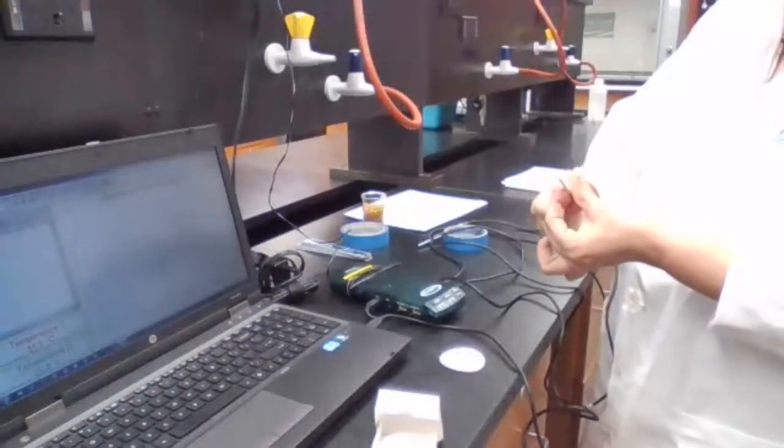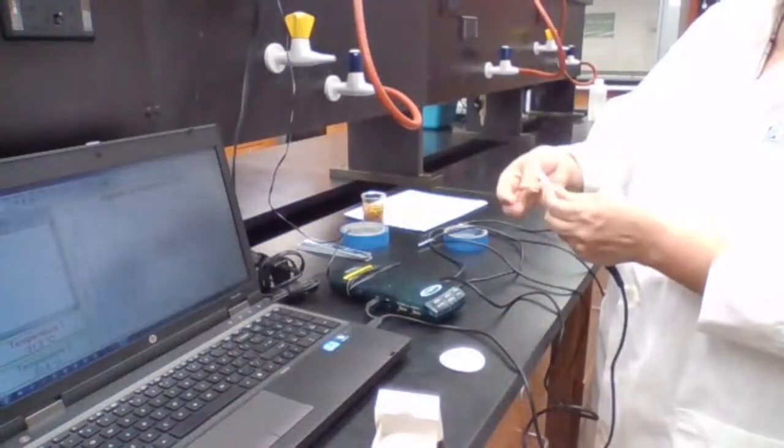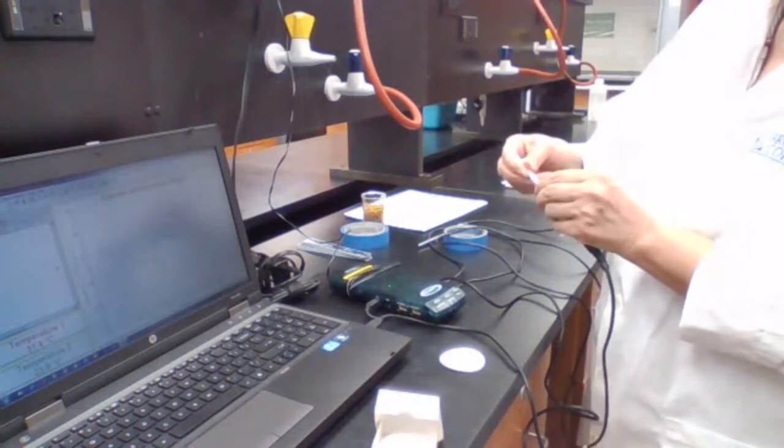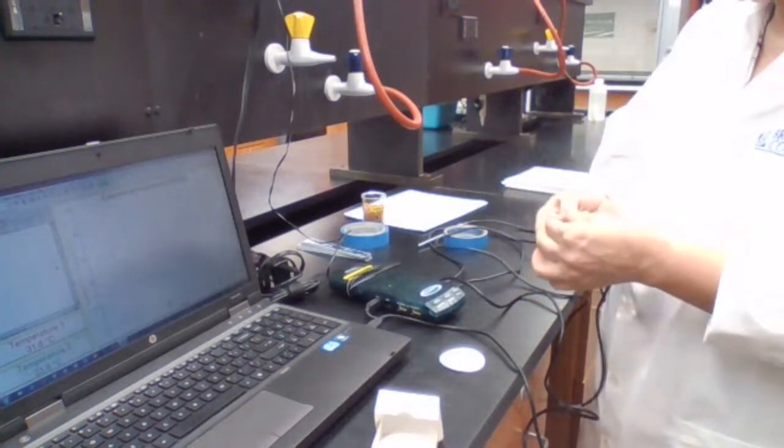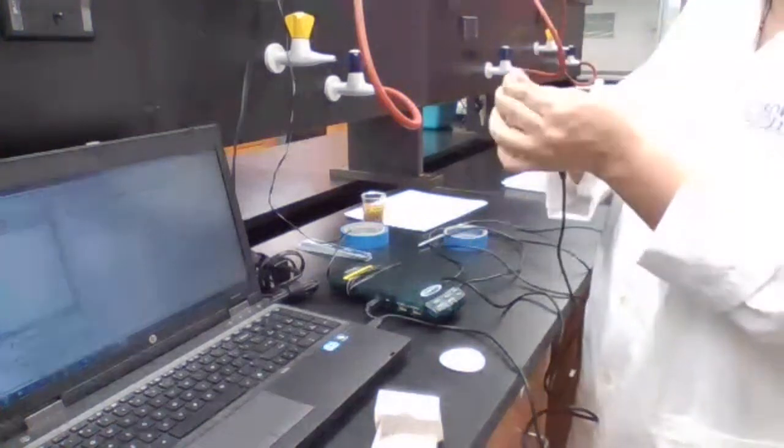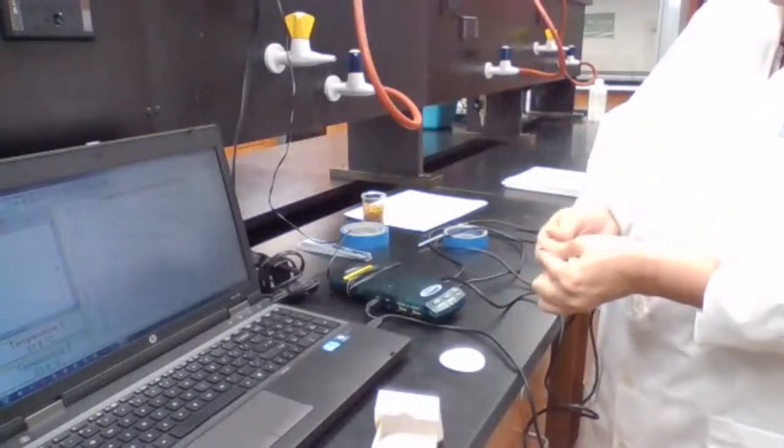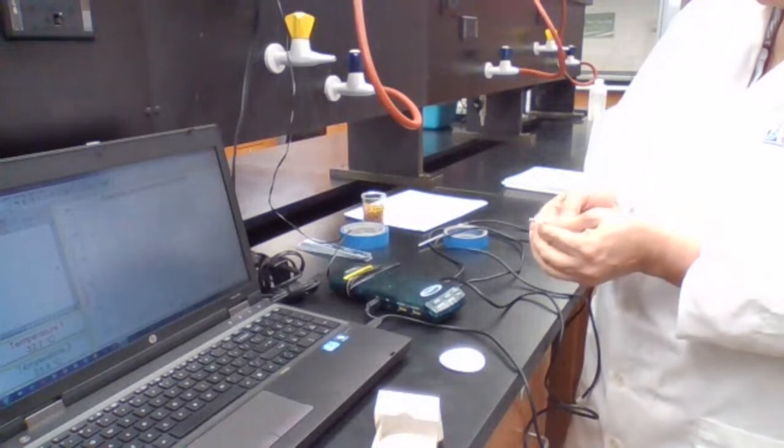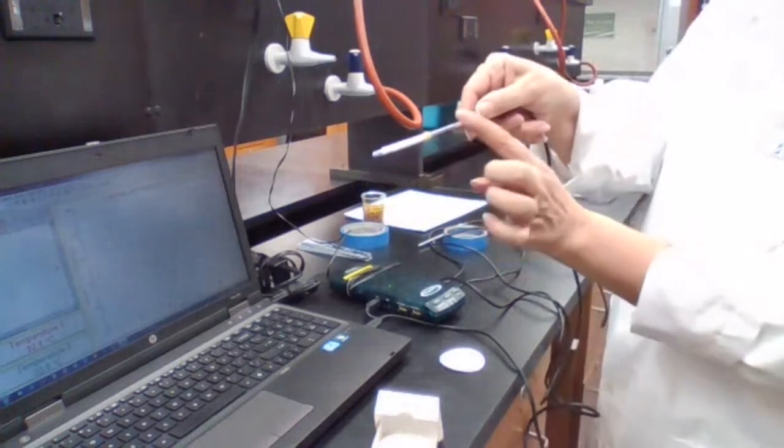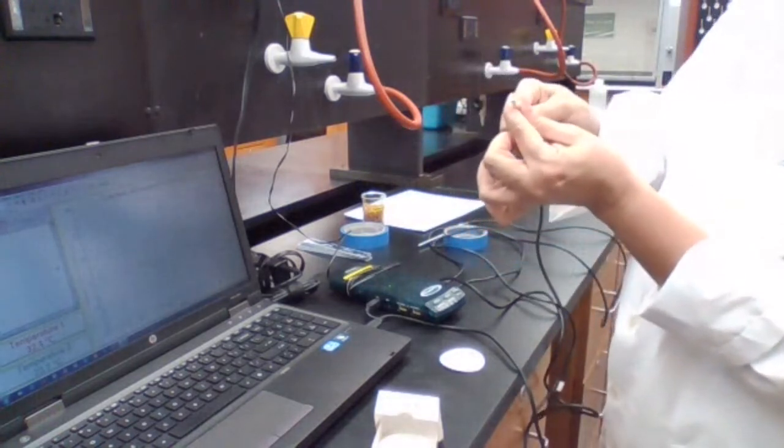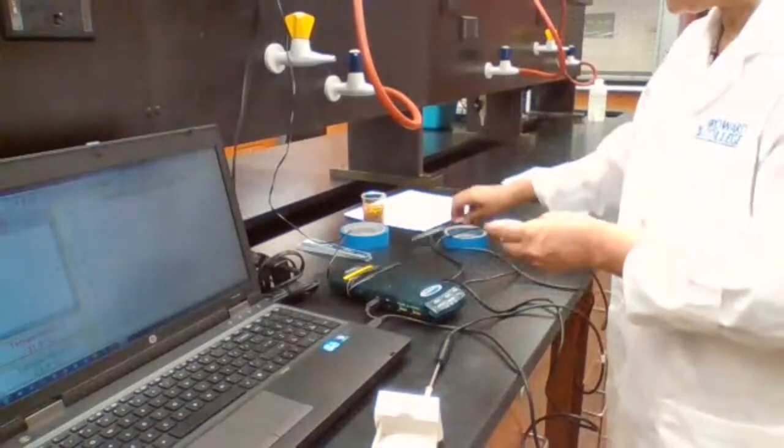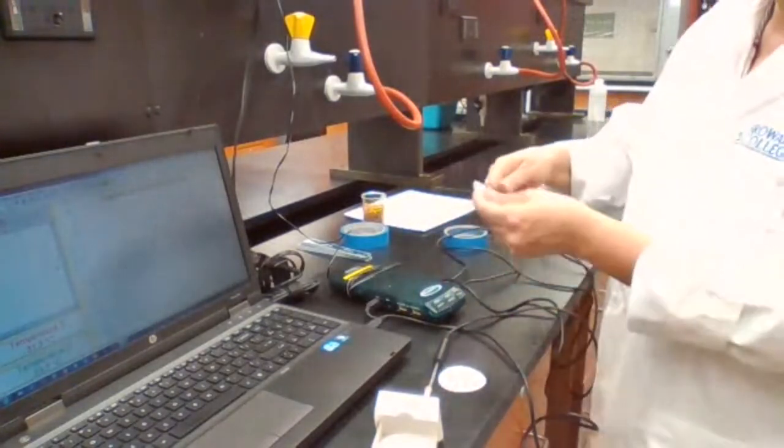Then it's going to evaporate and check the temperature for evaporation. I don't want to get it on the way of the paper, so it has to hold the paper. Sometimes it is loose and going to come up, so I usually have it pushed, part of it covering the front part, covering the paper so it's not loose. But when I am placing it in the liquid, it doesn't drop inside the liquid. The second probe is going to be prepared similarly.